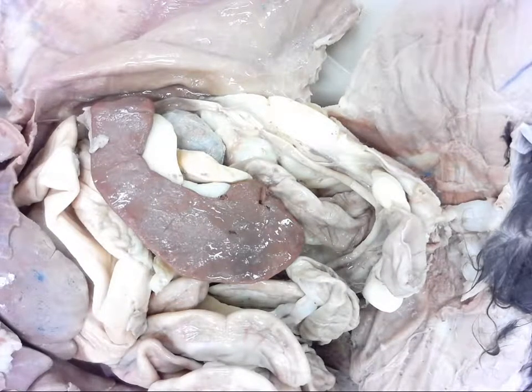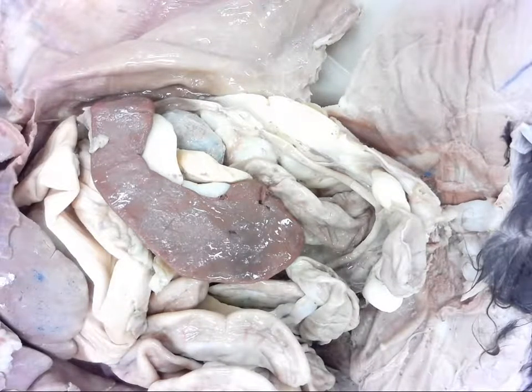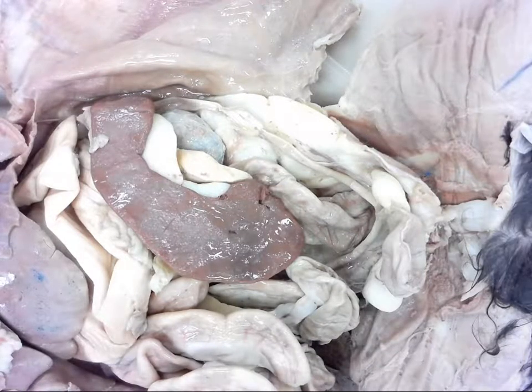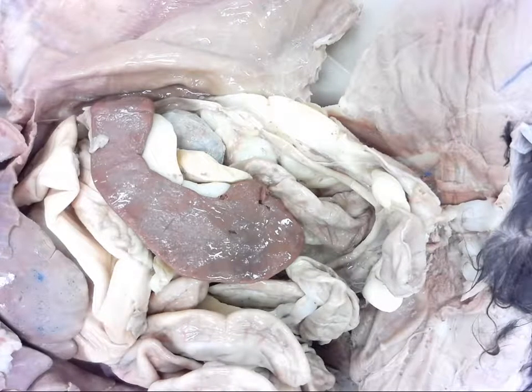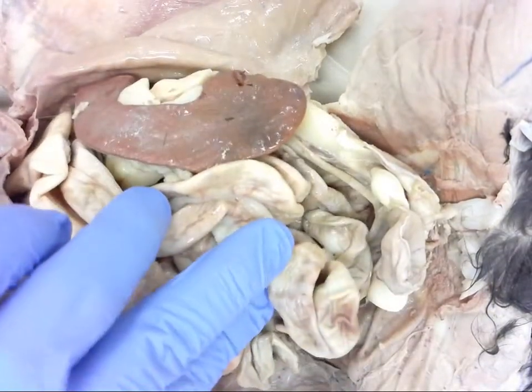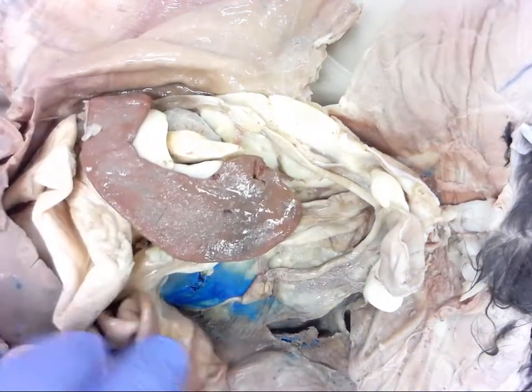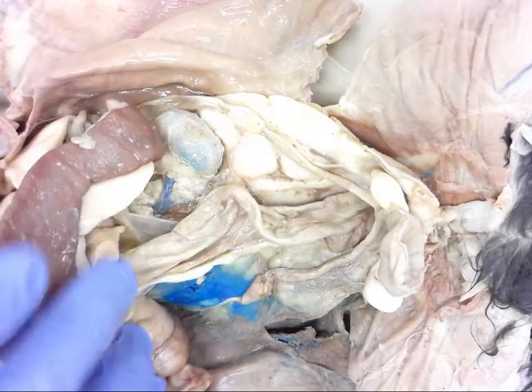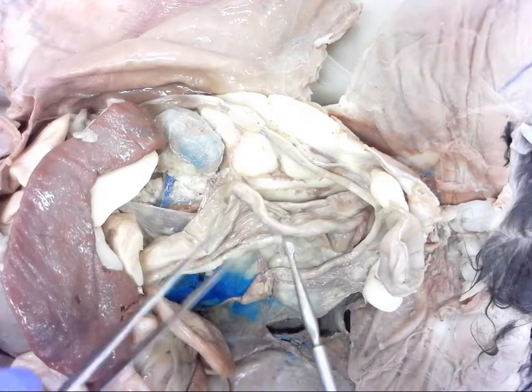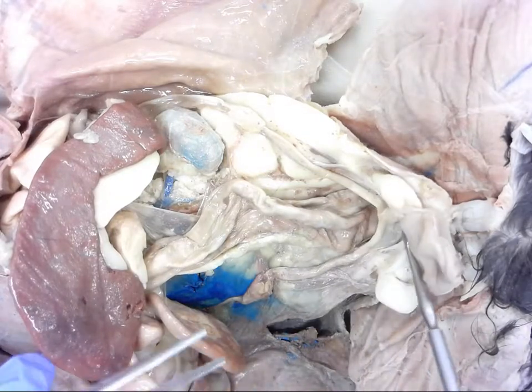In this video we're going to take a look at the female reproductive system and do a bit of comparative anatomy between felines and humans, as well as some comparison between pregnant and non-pregnant. What you'll see in this video are the abdominal contents - we have the spleen, the small intestine - and I'm going to move those up and out of the way. Underneath we have the large intestine and the descending colon, and on each side of that you're going to see some structures.